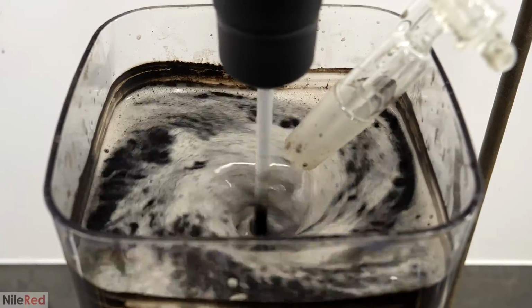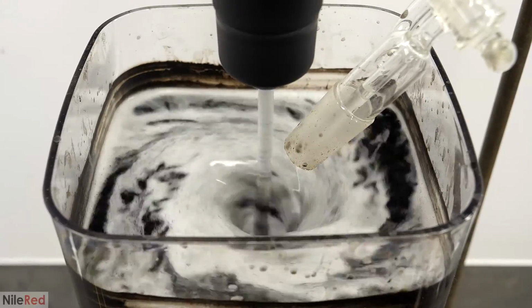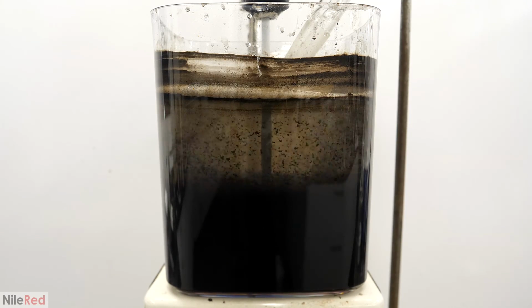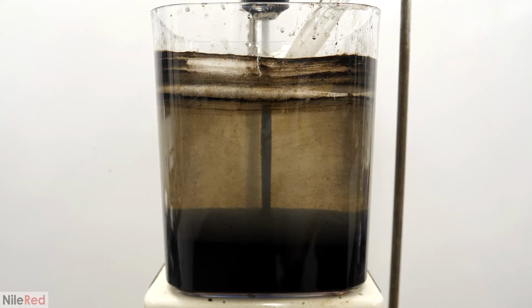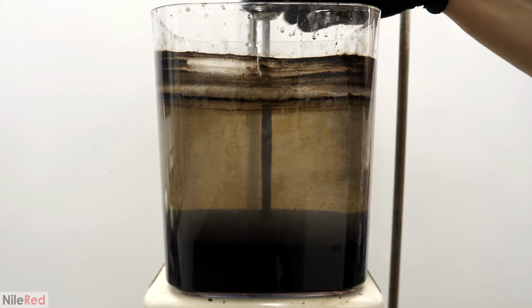The foam all very quickly turned white, and a lot of magnetite started separating out. This wasn't immediately evident though, because it was still stirring pretty strongly, but when I turned it off, it all quickly sank to the bottom. At this point, all the magnetite was ready, and now I just had to separate it from all the water and clean it up a bit.